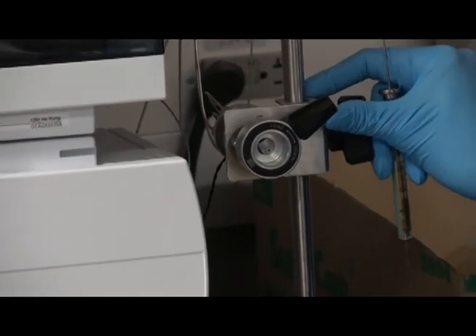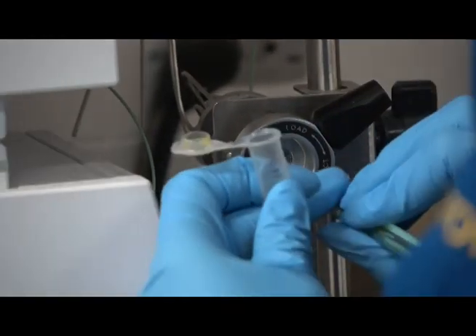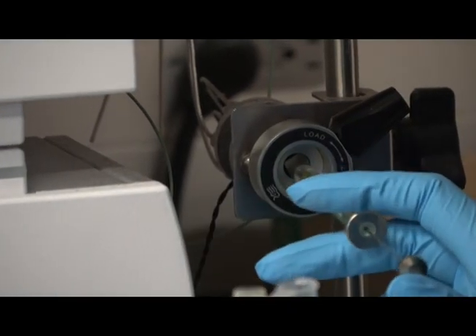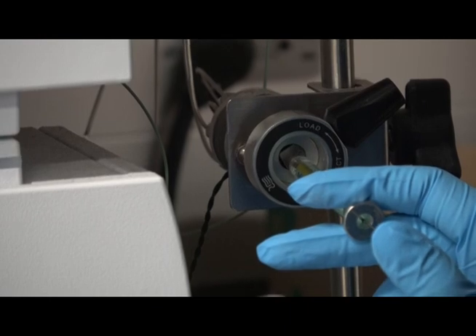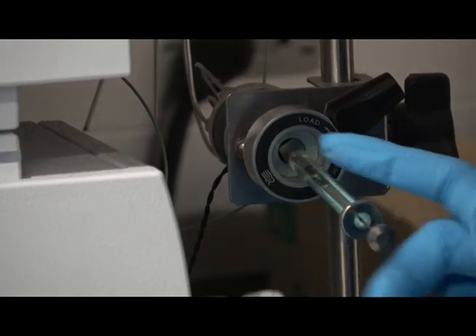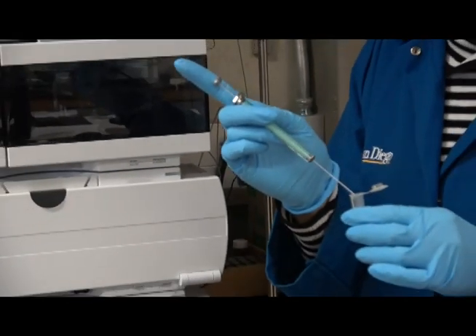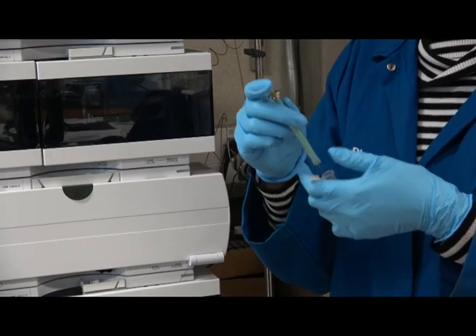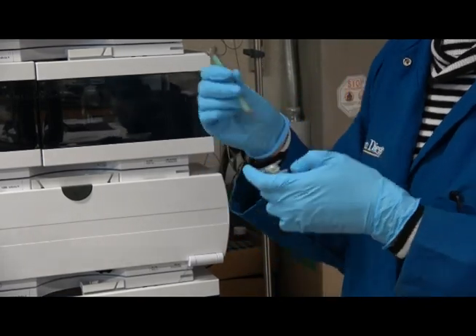meaning up, so like if you push, like it's all the way up. So you go in, and you inject 20 microliters or so. Be careful not to inject any bubble when you do this, otherwise your bubble is also going to get injected on the column, and that's obviously going to mess up your data. So that was injection number one.